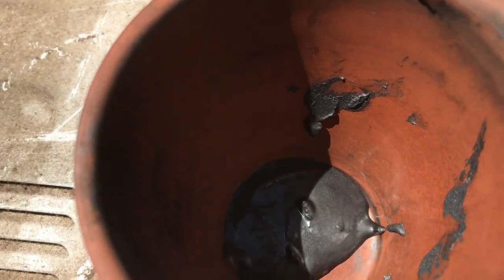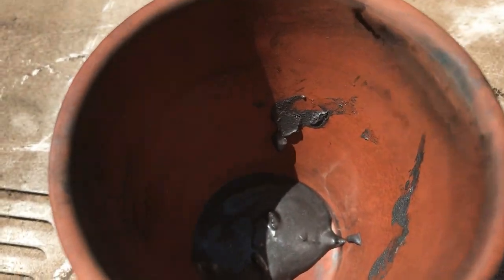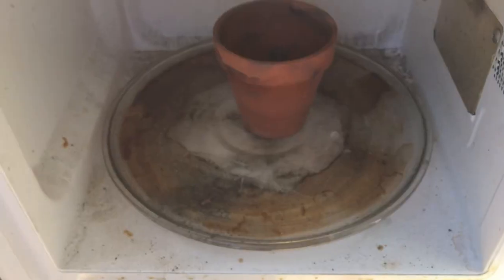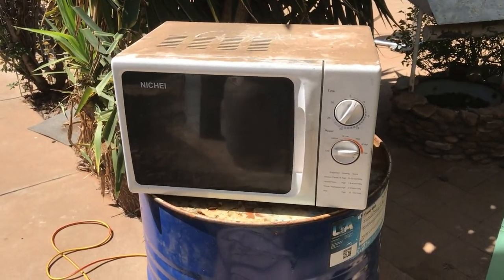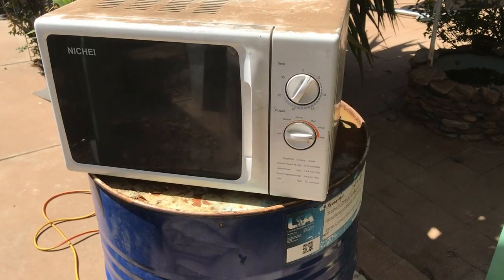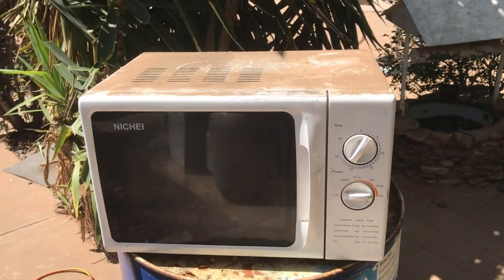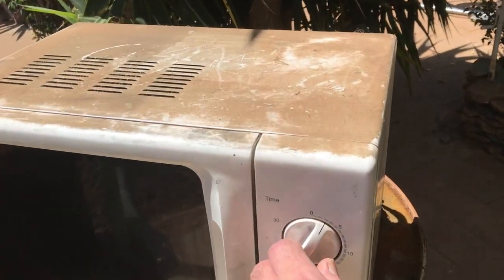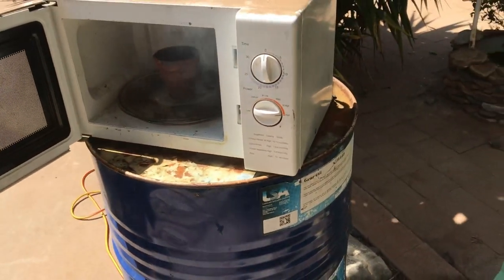The five grams was stirred for two hours. I've got half of it here — the next stage is to expand it in the microwave. I'll just stick that in there — don't breathe the fumes in. Okay, it's reacting pretty well.